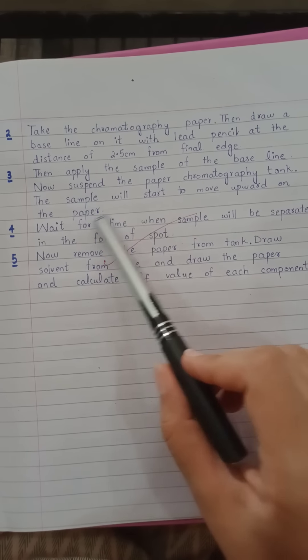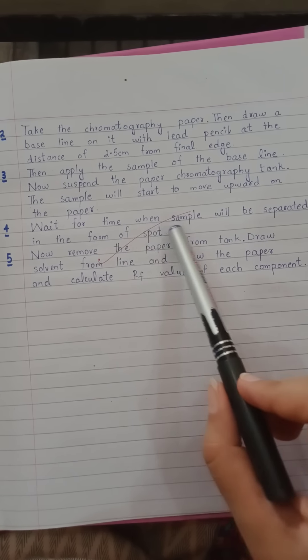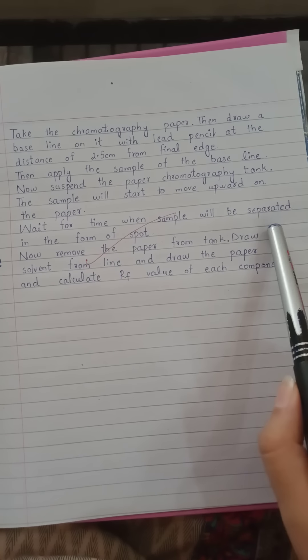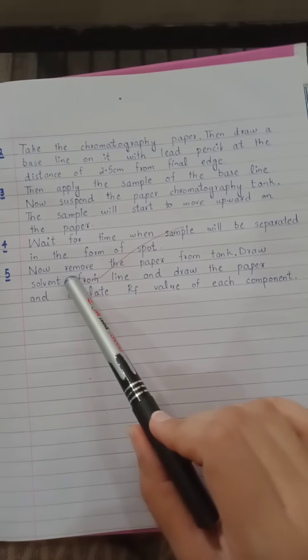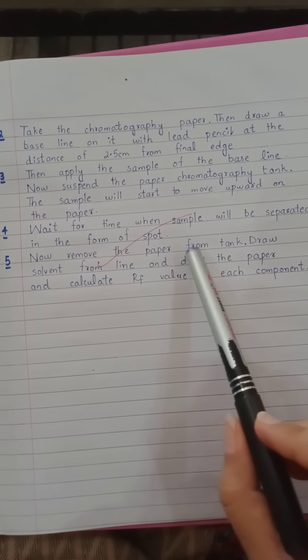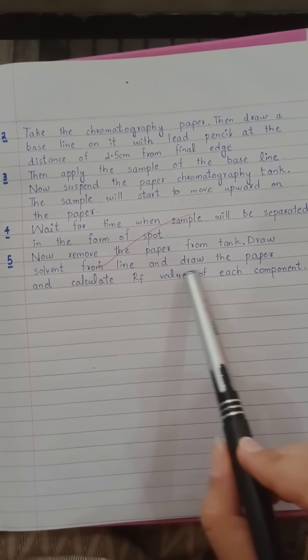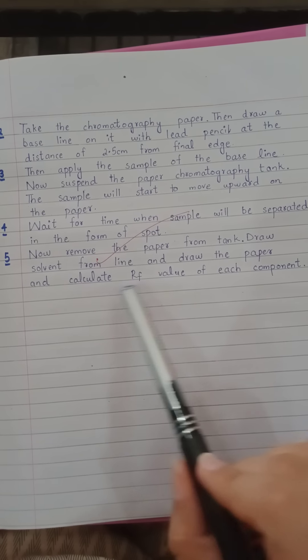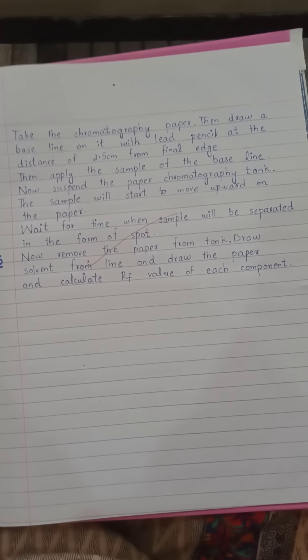Now suspend the paper in the chromatography tank. The sample will start to move upward on the paper. Wait for the time when the sample will be separated in the form of bands. Now remove the paper from the tank, draw the solvent front line, dry the paper, and calculate the Rf value of each component.